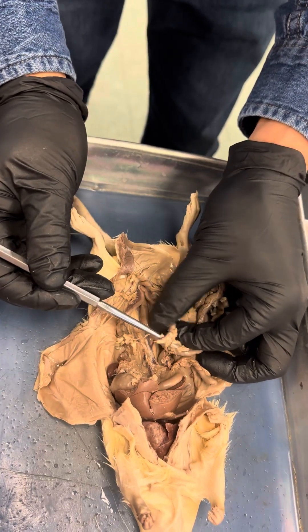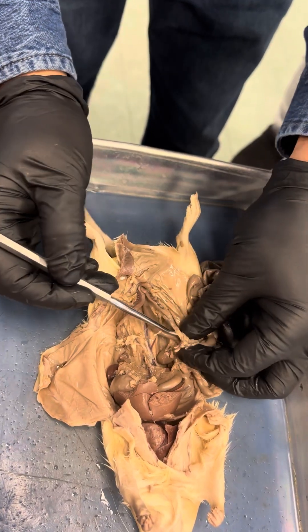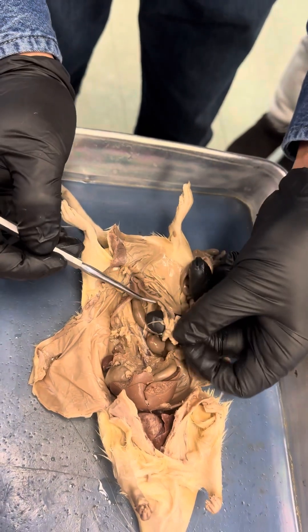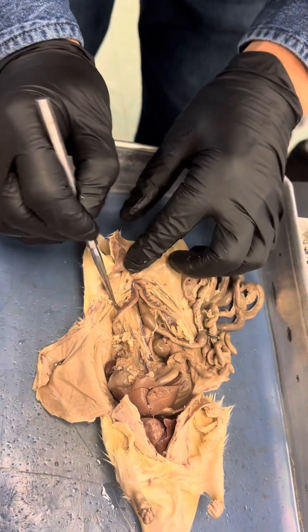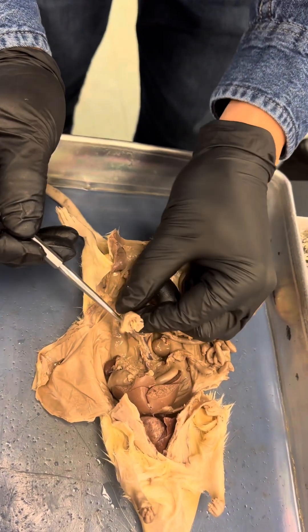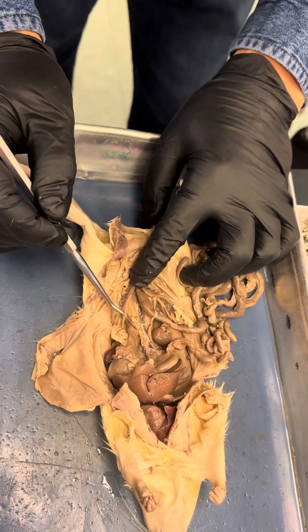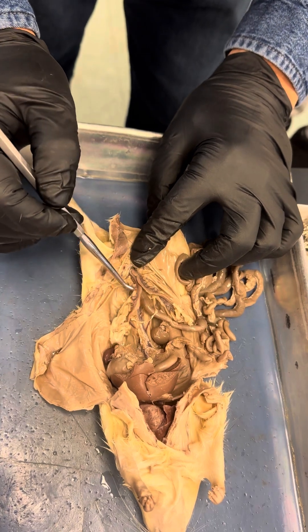So in the female you will see the uterine horn right here, and the ovary. This is the uterine horn — there are right and left sides of the uterine horn, with the ovary at the tip. The fetus will grow up in this uterine horn right here.